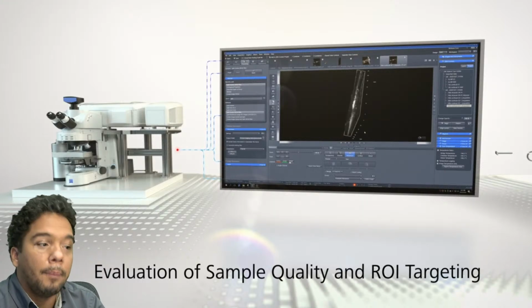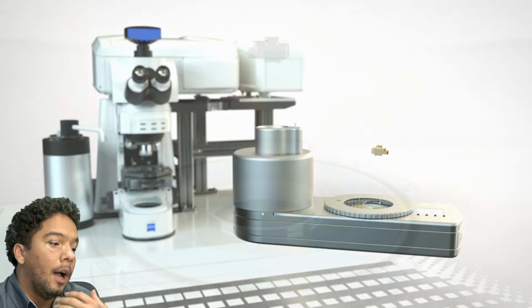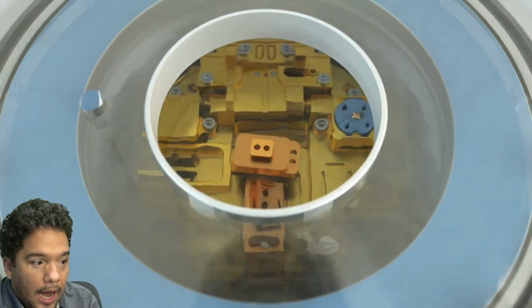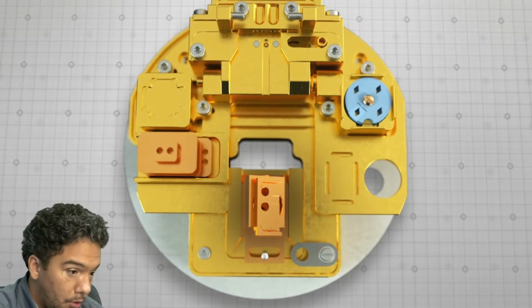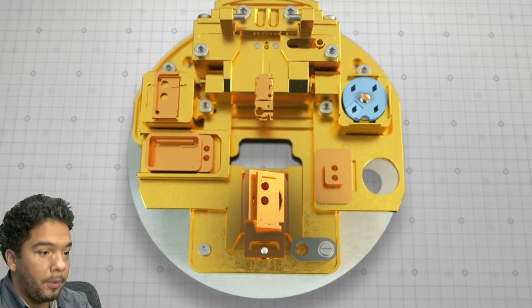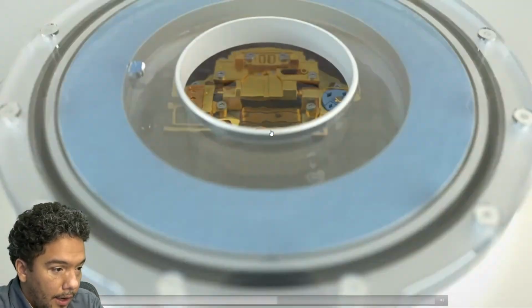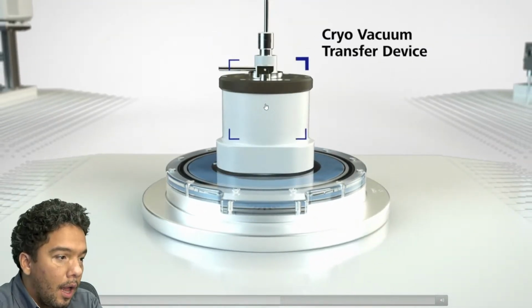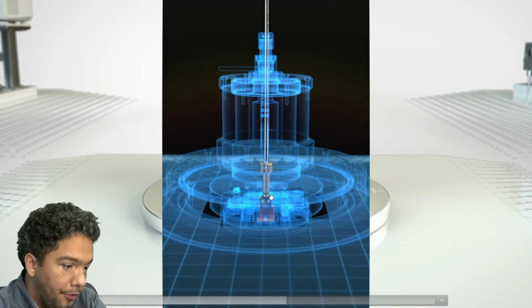You are screening your sample. You are getting really good detail from your samples, and you can be ensured that you have the right sample before you go to the electron microscope. After you collect that kind of information, the sample is ready to load in the proper sample holder. And with the cryo vacuum transfer, you go and collect.